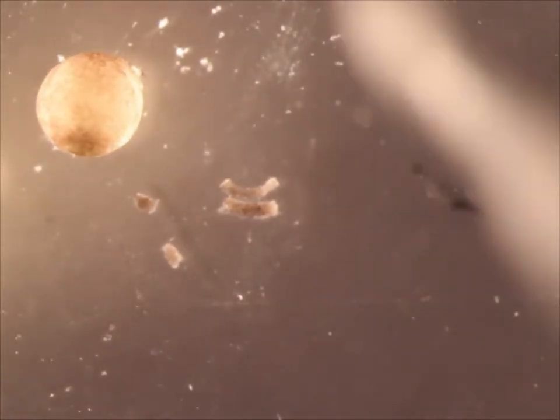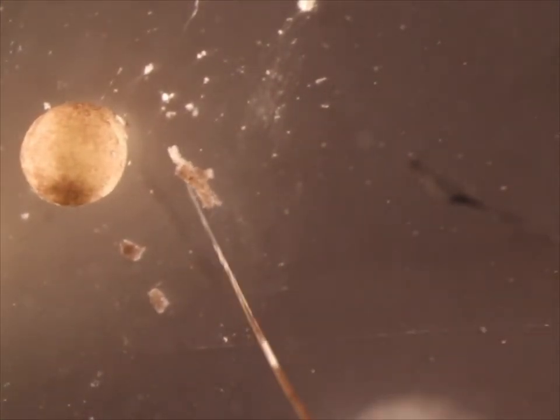Once the desired shape is achieved, a pipette is used to transfer the explant to a fibronectin-coated dish. This is not done in this video.